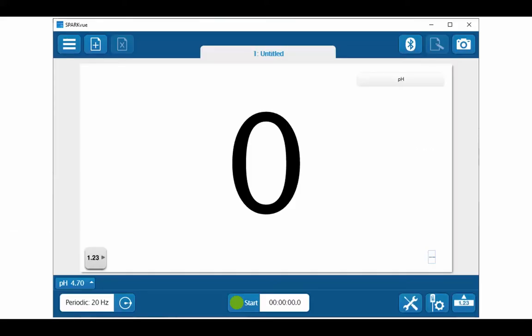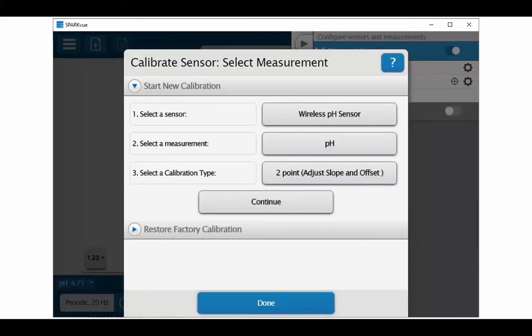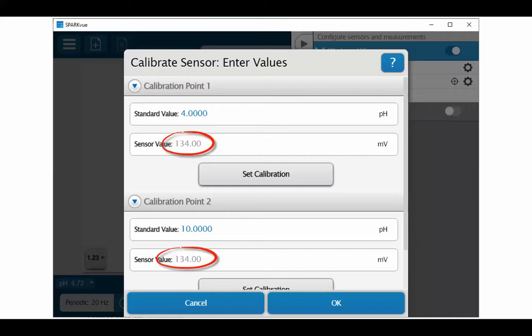Within SPARKvue, you can select the calibration of the sensor and then select pH. Once you've done that and you've selected calibration, you can click on continue. And then within this calibration screen, it will show the sensor values at each of the standard values for which you place the pH probe into the buffered solutions. From these values of the voltage produced from the probe, you can see what the sensitivity of the probe is.